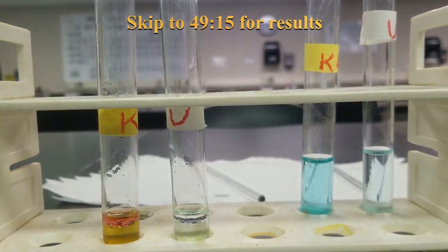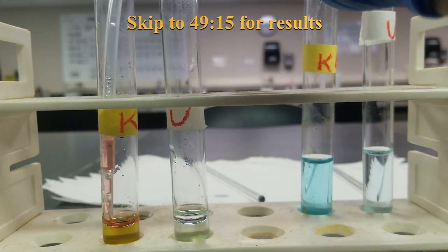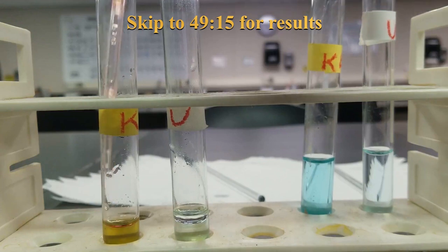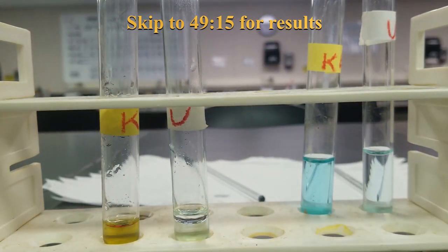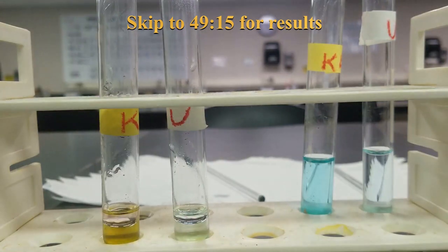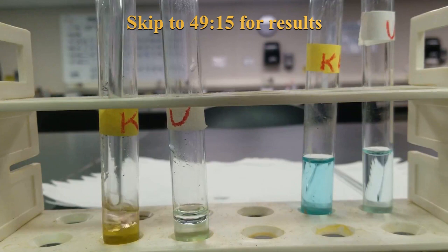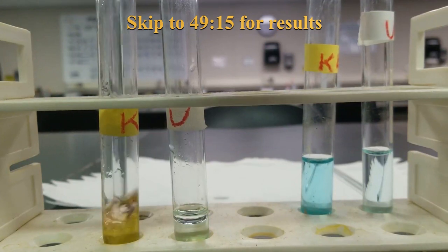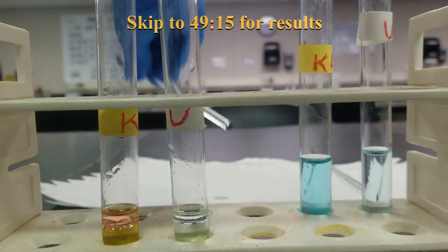Still see we still have coloration there, so we're going to want to get rid of it, pipette it out. Get rid of it, add some more toluene. Mix it up again. You can see our color is getting lighter and lighter.